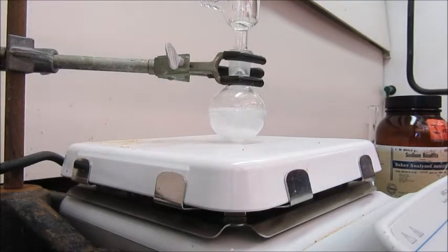And you should be able to see that the solids are dissolving. The solids are, remember, the byproducts from the oxone reaction. So we should see some KHSO4, which is formed from the reaction of KHSO5. And we're also probably seeing other salts. We've got a little bit of sodium chloride in there as well.